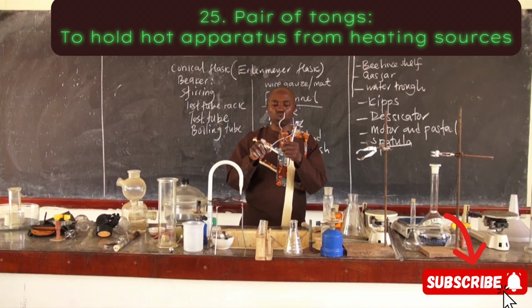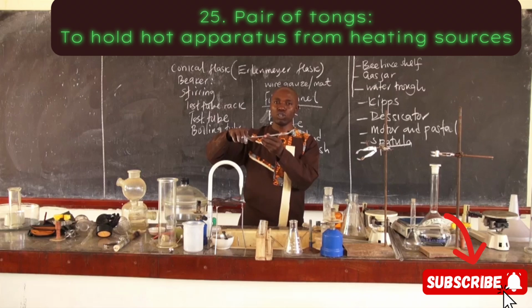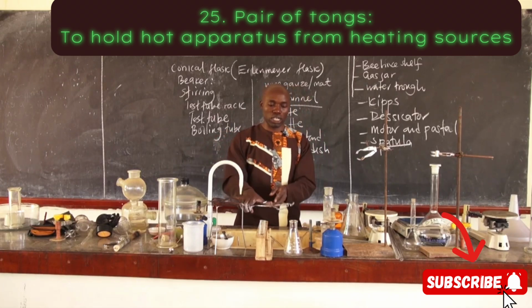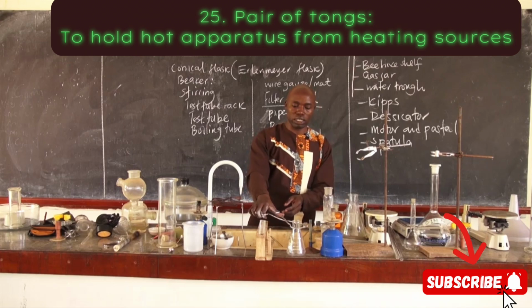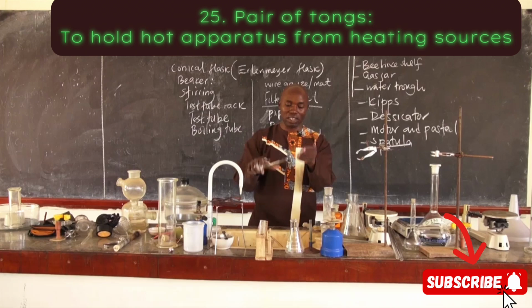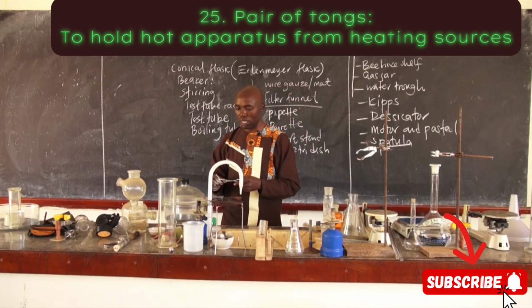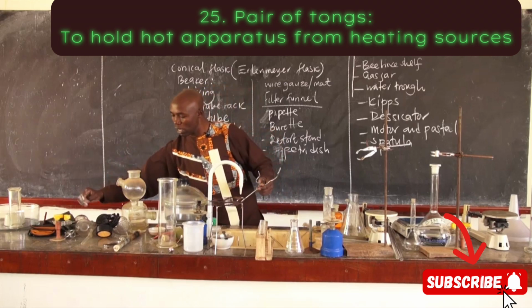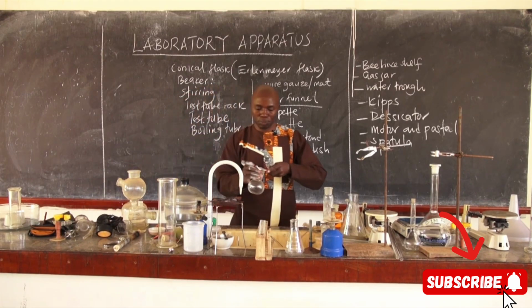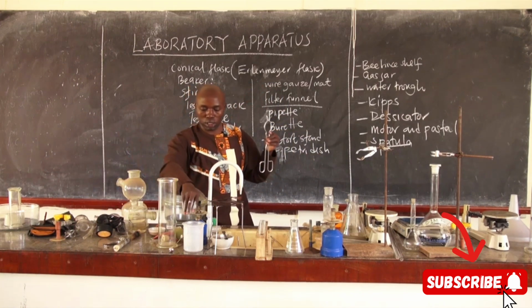It's normally used to hold the hot apparatus that are on the heating flame. So I can use it to hold this. This can't fit there. There are other sizes which can fit in this one, but you can hold any apparatus. Maybe can hold even a larger apparatus. Let me see if I have one that can fit here. Not yet. This is kind of a very big pair of tongs.